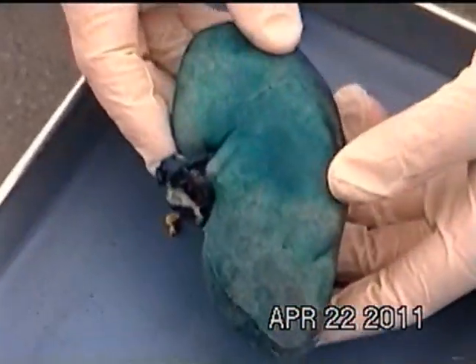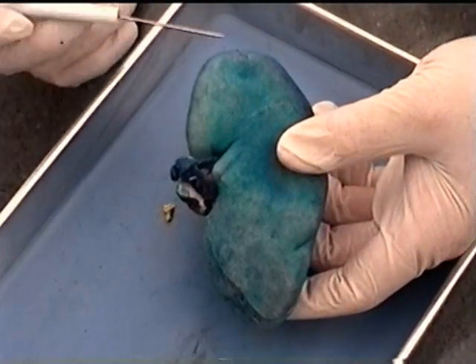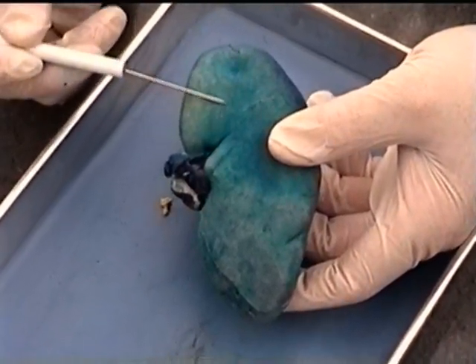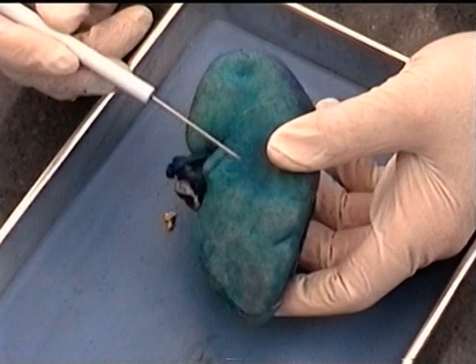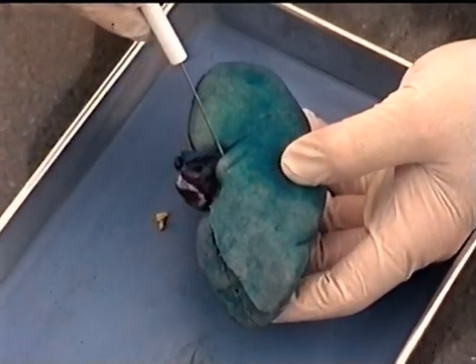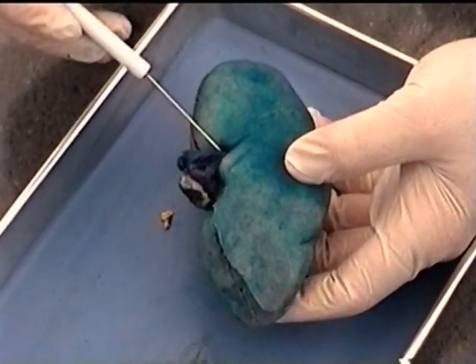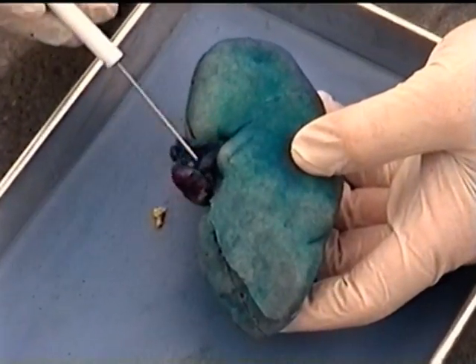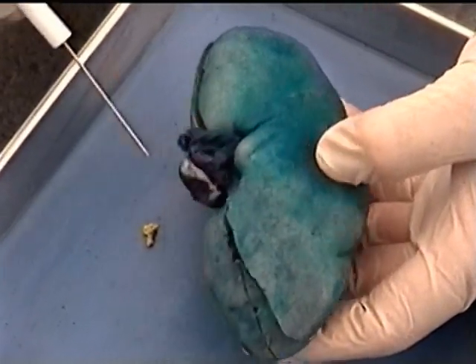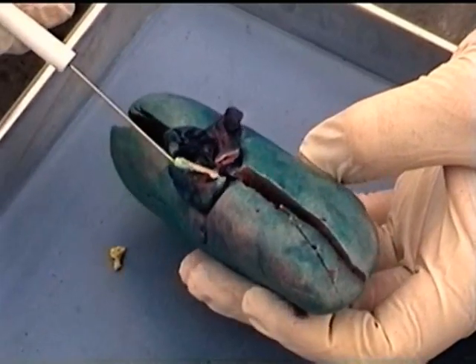So recall that the kidney is retroperitoneal. So the outer part of the kidney is a capsule. So what we're looking at is the renal capsule. Then what we're seeing here is the hilus of the kidney, which is where the blood supply and the ureter exit the kidney. And what we're seeing is a renal artery, a renal vein, and then the renal pelvis, the end of the renal pelvis right here.